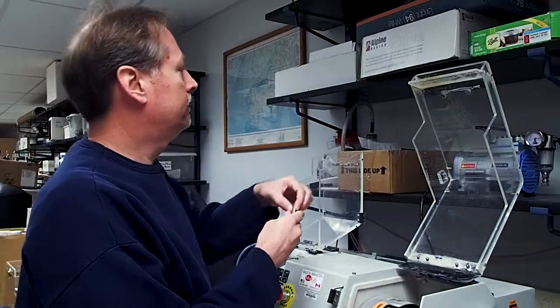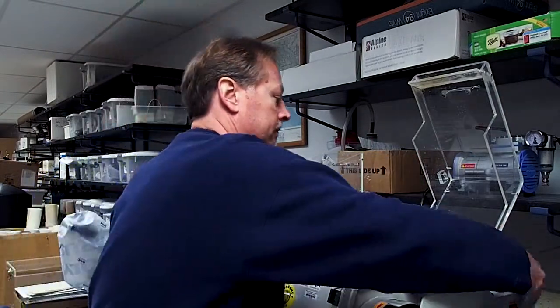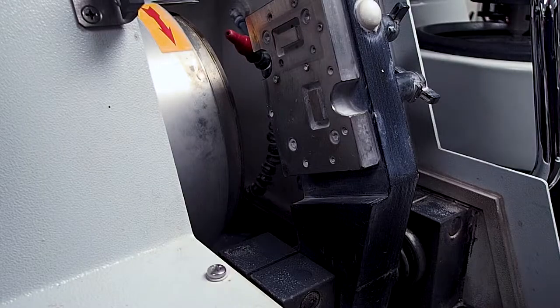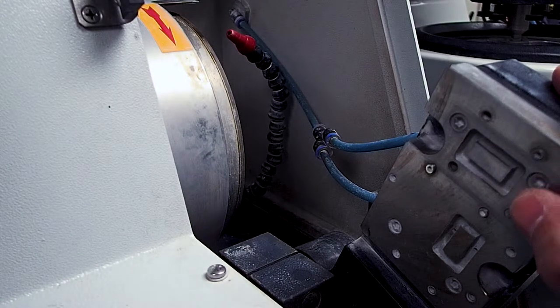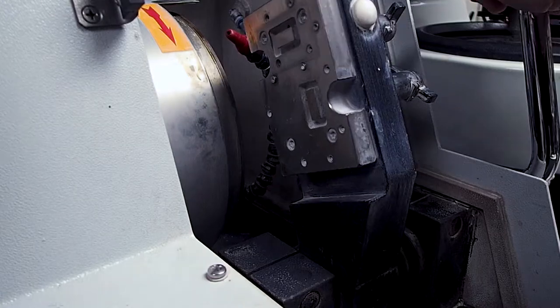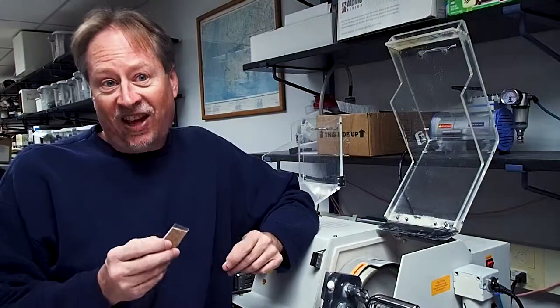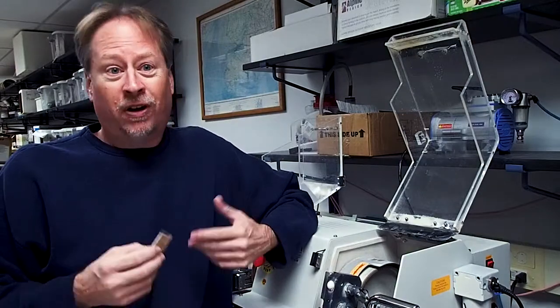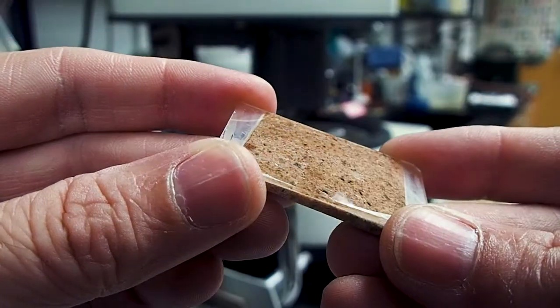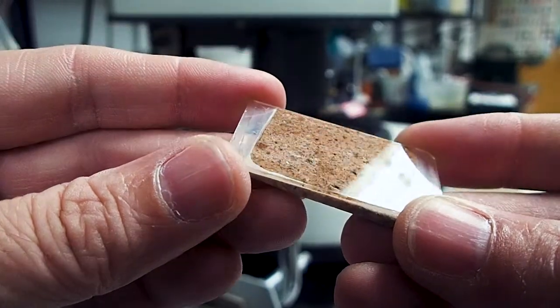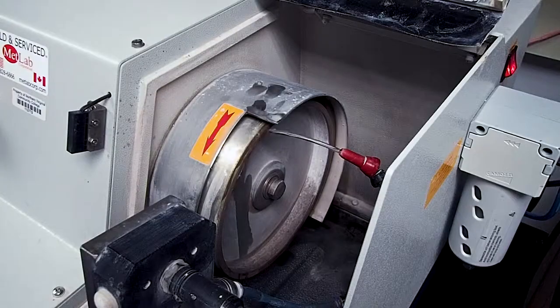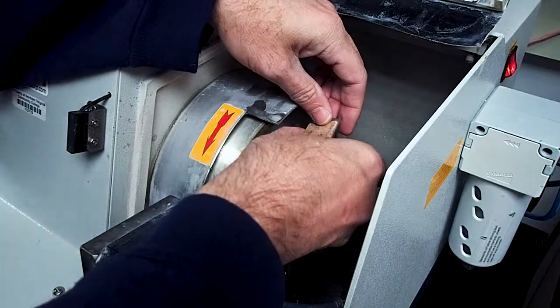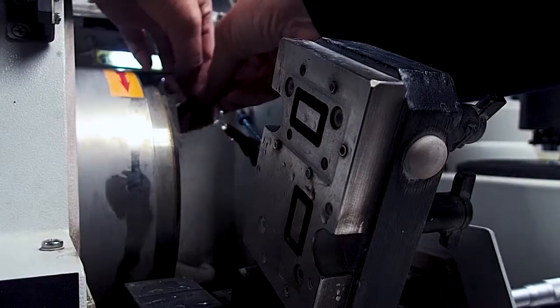As we've done before, I'm going to turn on the vacuum pump and the Geoform. Once the equipment has been powered on, I will inspect the vacuum chuck to make sure it is clean and free from debris. It's going to be important to maintain a tight vacuum seal on our slides during the grinding process or else we risk damaging our slide. Take a moment to inspect the surface of the glass slide to make sure it is also clean and free from any dust or debris. Once you've verified that everything looks clean, I will turn on the water on the grinding side of the Geoform and wet my slide to create a better vacuum seal.